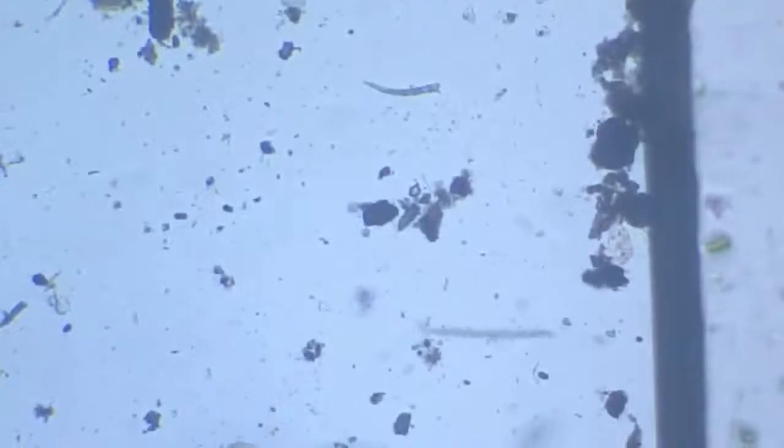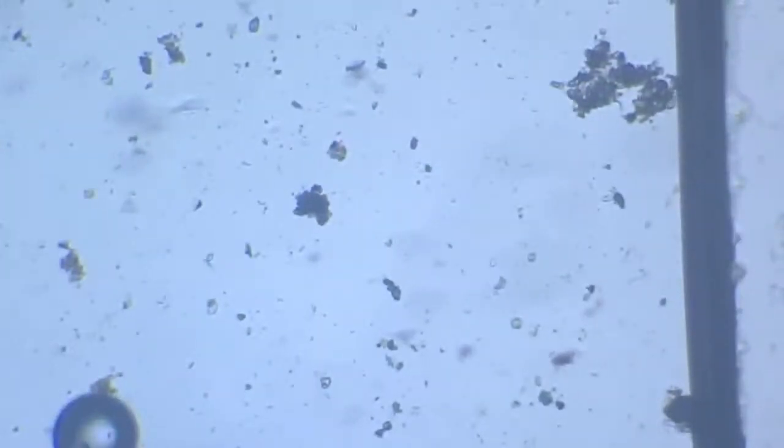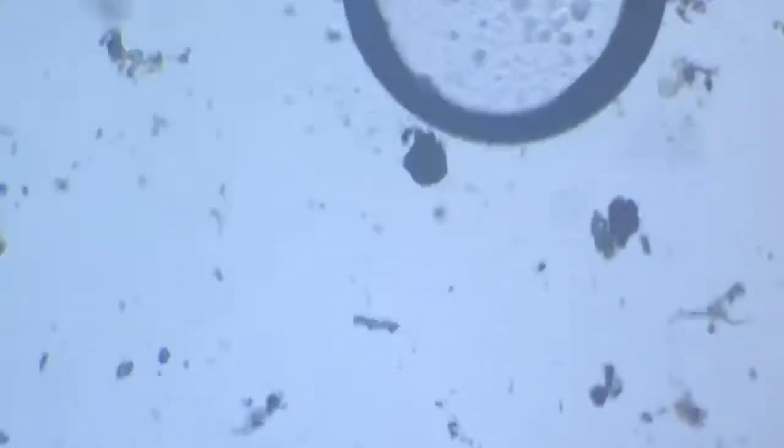What was that? Okay, so we have a nematode. There's a nematode trying to escape the clutches of its adherents. Go back. Try to find that fellow. It'll be around.